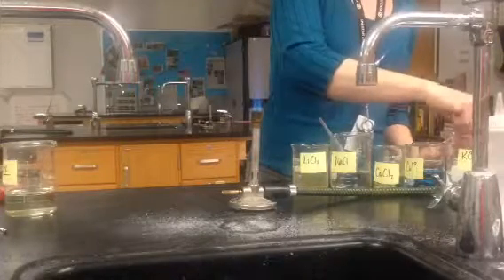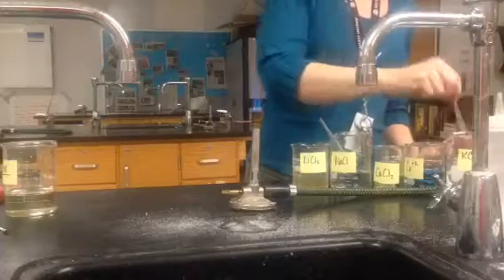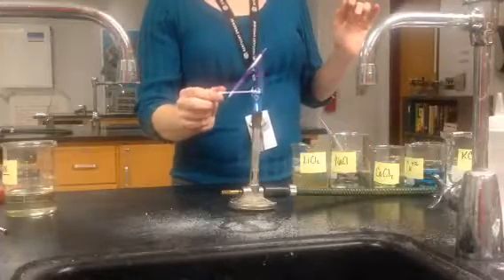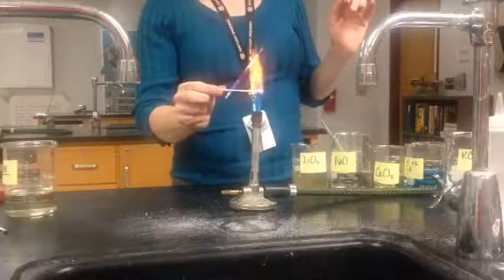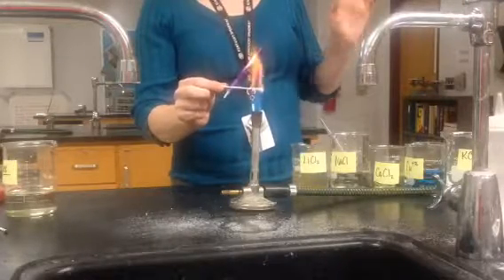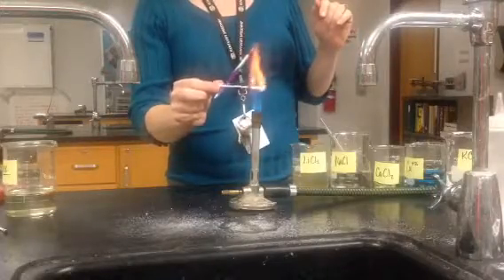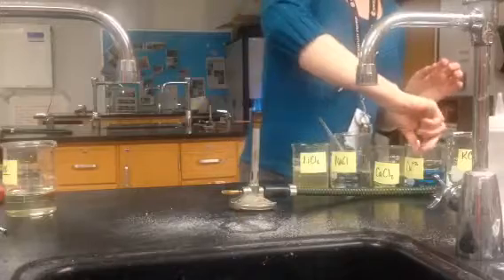The first one here is potassium chloride — it's the potassium ion. It burns kind of a peachy purple color. You'll notice that your unknown was an orange, so that can't be it.